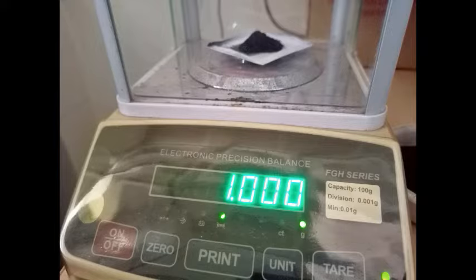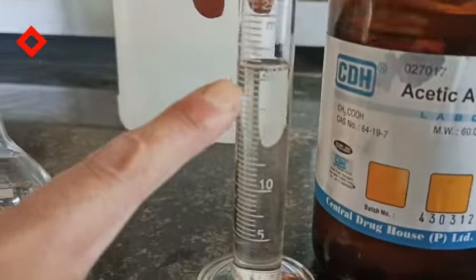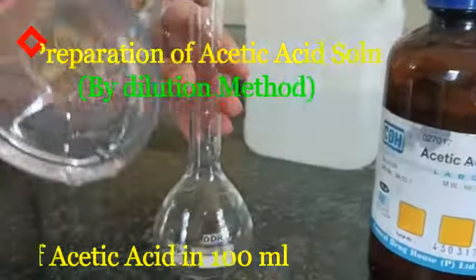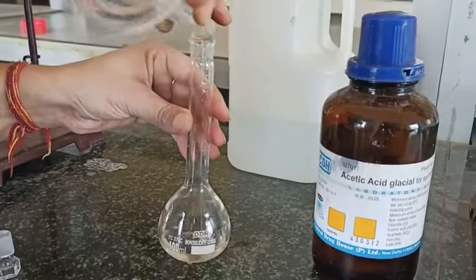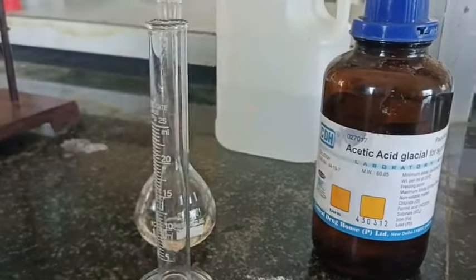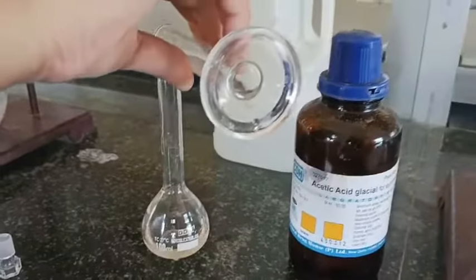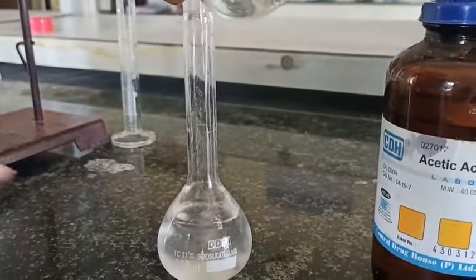For this we require charcoal and acetic acid. The first step is to prepare the stock solution of acetic acid. For this experiment, I have taken 20 ml of concentrated acetic acid and I diluted it with deionized water up to 100 ml — so 20 ml in 100 ml.